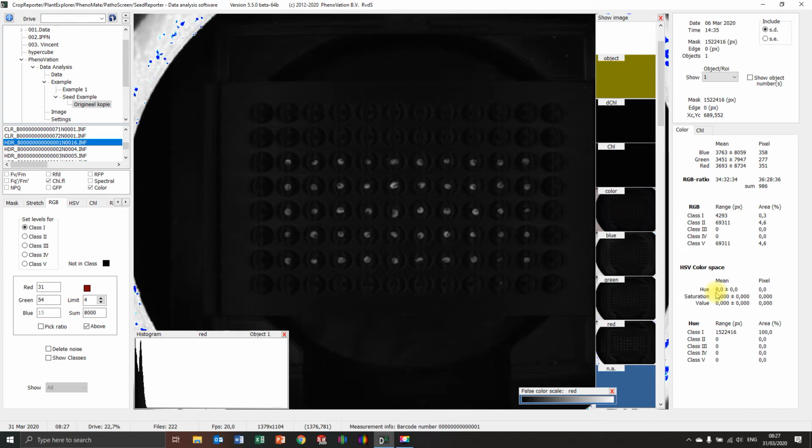Welcome to this tutorial. In this tutorial, I'm going to show some cases I received from our clients using our equipment, and they didn't really figure out how to use the analysis software or what the proper settings are to get, in this case, the seeds out of the background. I'm going to show you how it's possible to do it and also give you some tips and tricks.